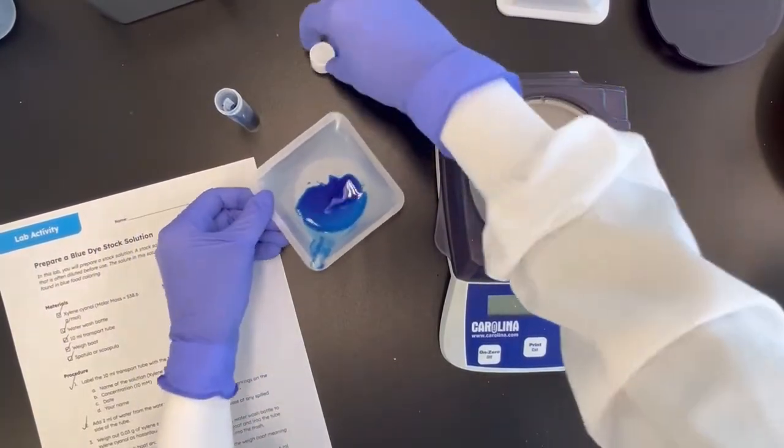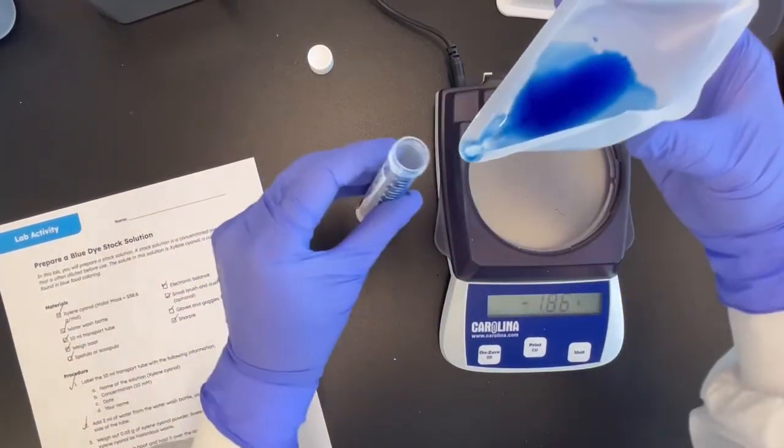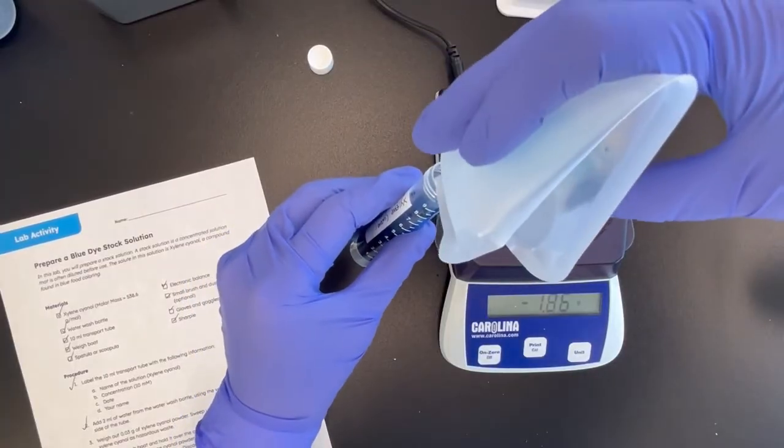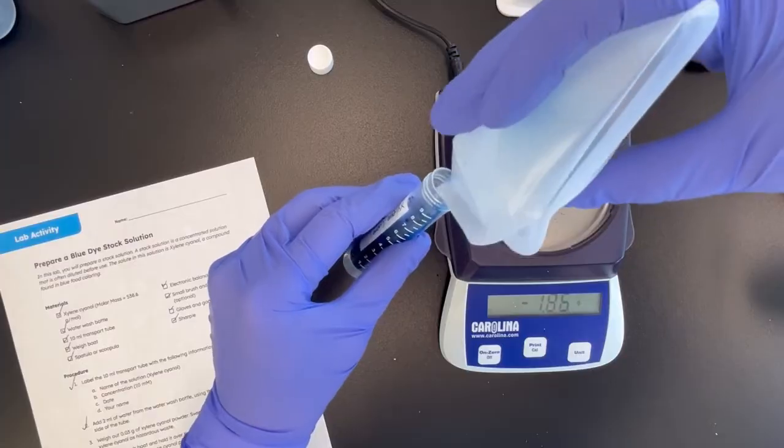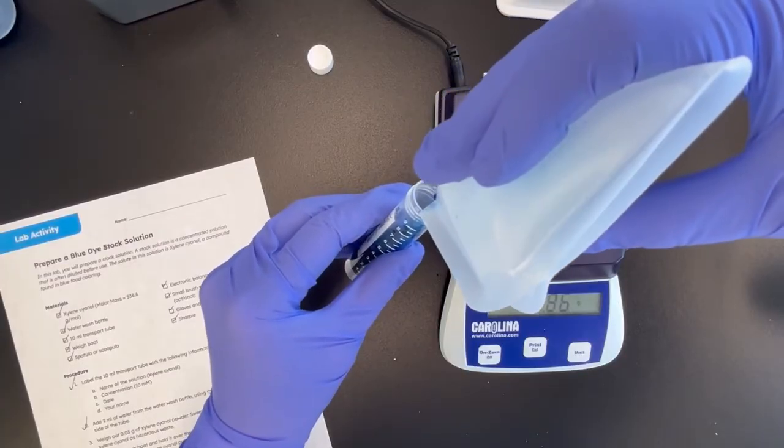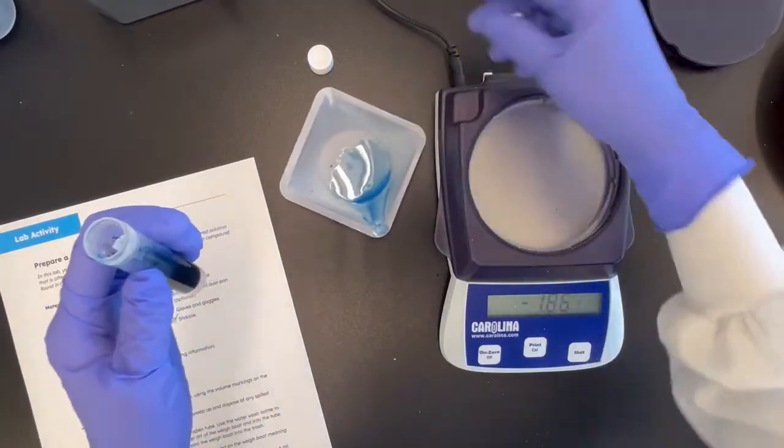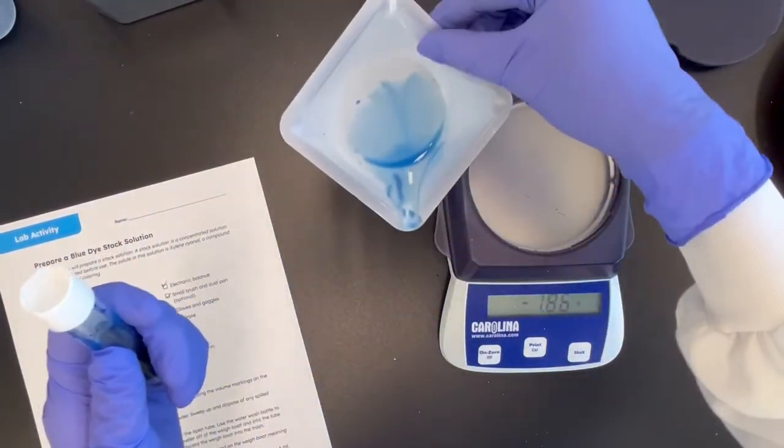I'm going to have to put this down this time. Half. And transfer that volume. Okay. A little bit that's left. There's really not much they can do about it. This is okay. I'm going to leave this behind.